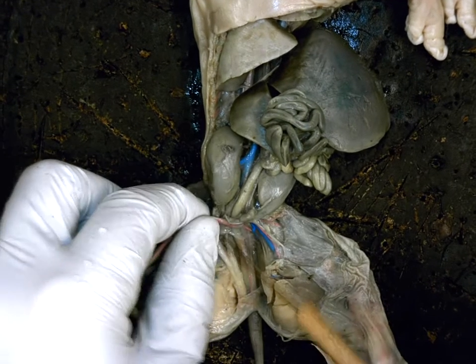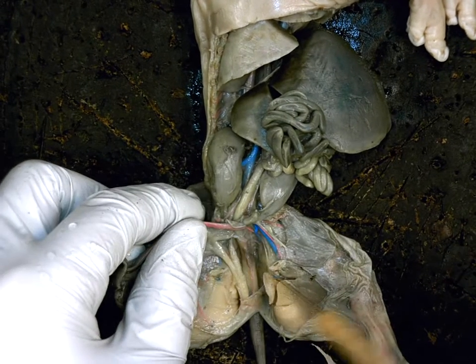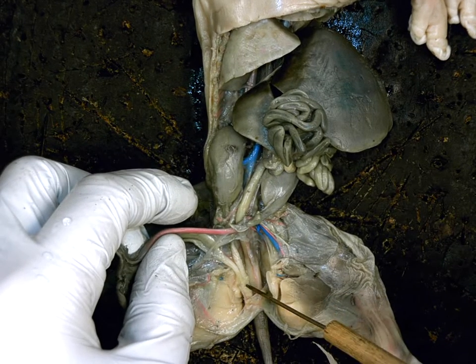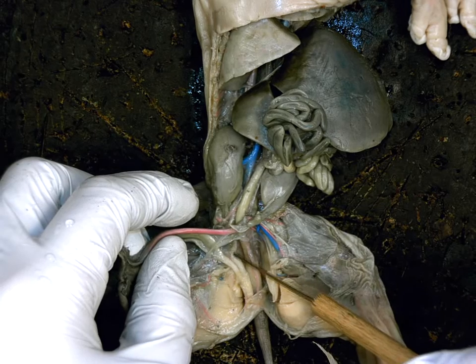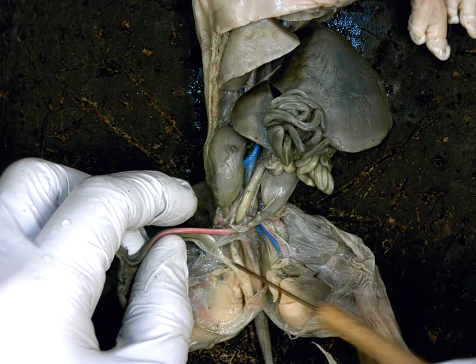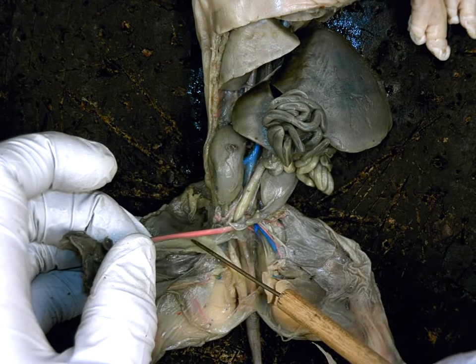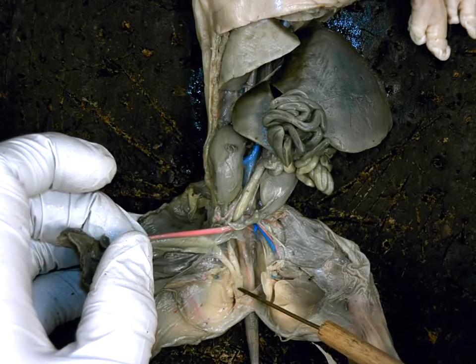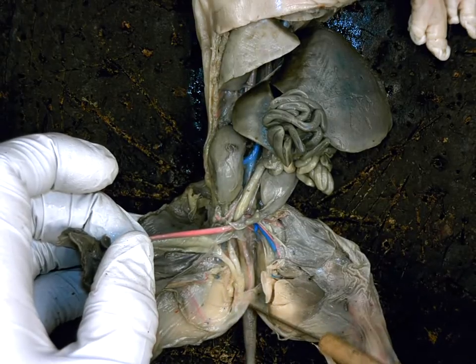If I'm going to pin the uterus, I'm going to pin it from this side because obviously it's much easier to see. You're going to see two tubes that fuse into one. The lower tube is the what? Uterus. The upper tube, which is in contact with the bladder, is the urethra. They both unite at the vagina and exit out of the vulva.